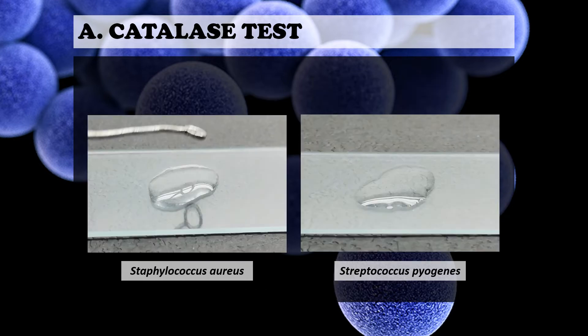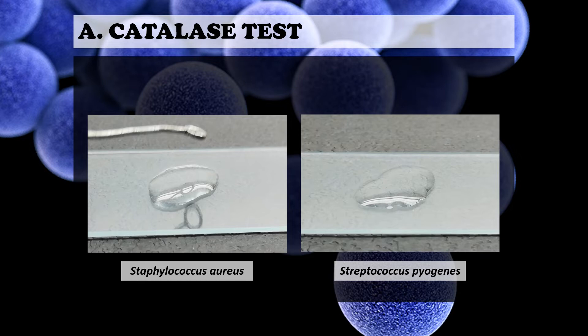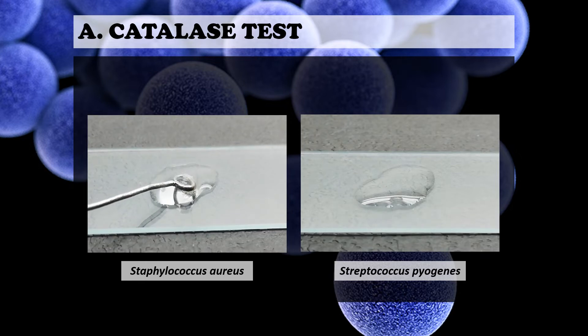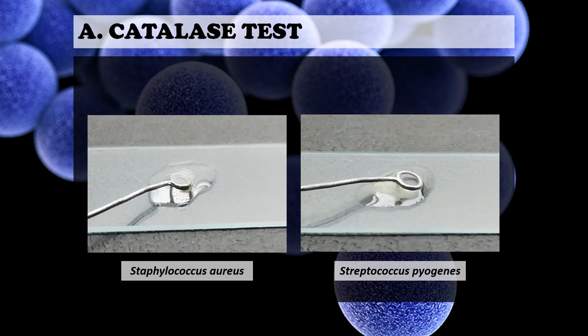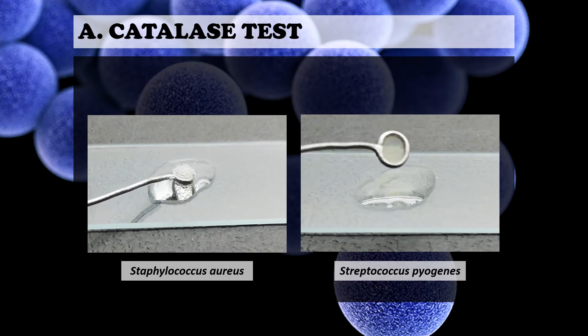Another way to observe the catalase reaction is using the slide method. You just put a drop of your hydrogen peroxide solution on a glass slide and then transfer your organism. The same reaction must be observed: Staphylococcus aureus is catalase positive while Streptococcus pyogenes is catalase negative.